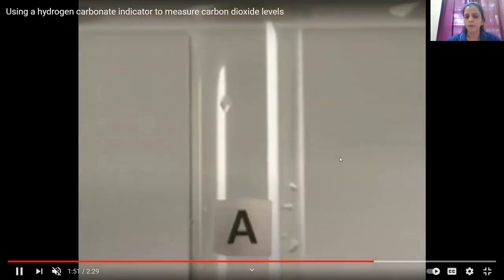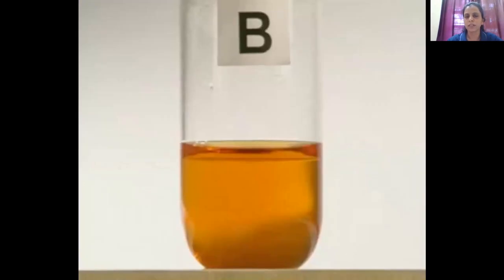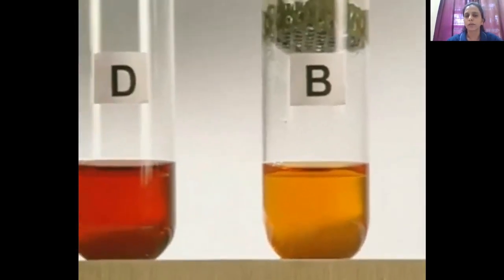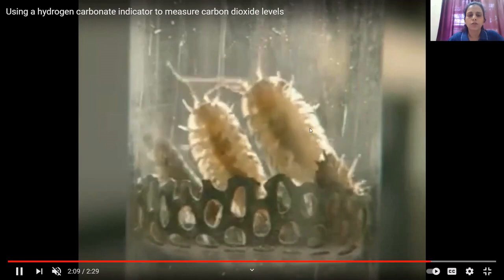In test tube C, if you remember, we have actually placed a leaf as well as wood lice. So this leaf has performed photosynthesis and wood lice have performed respiration. So the rate of photosynthesis and respiration was equal in test tube C. Hence the color of the indicator would be orange red. So I hope this experiment is clear to you guys.